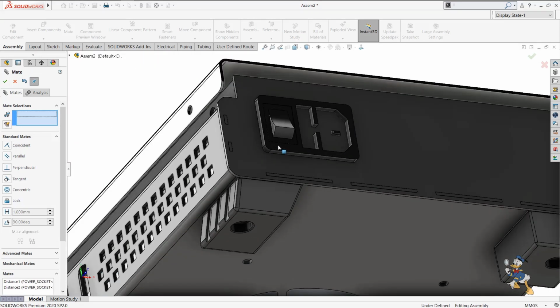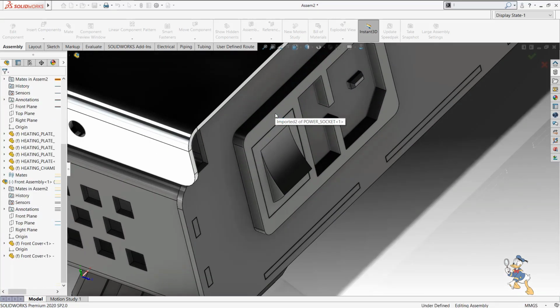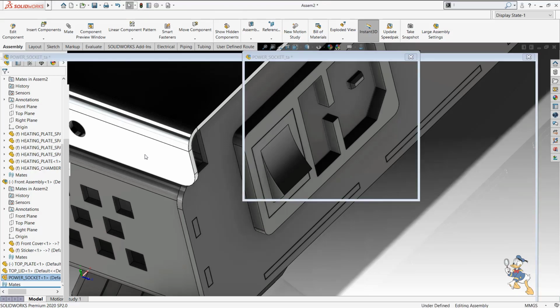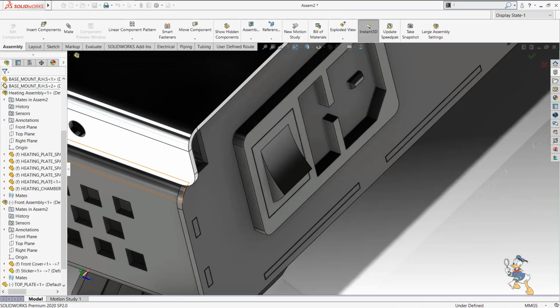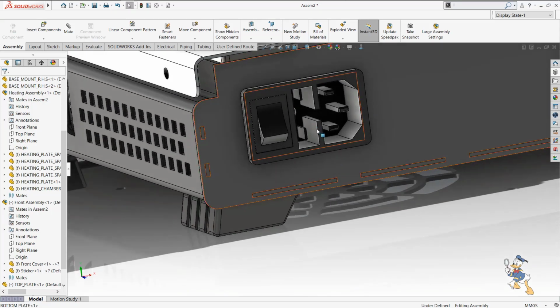Yeah, we have placed the part over here automatically, and then I just need to select a face of insert smart feature, and then I just need to select that face on which we need to generate that smart feature, and check OK. So let's see what happens.